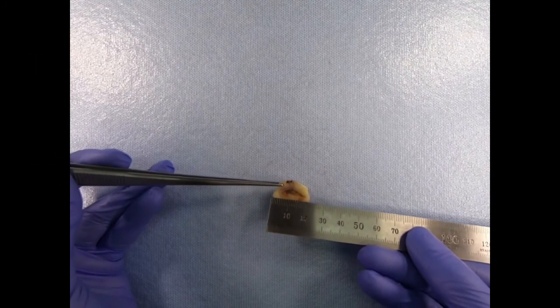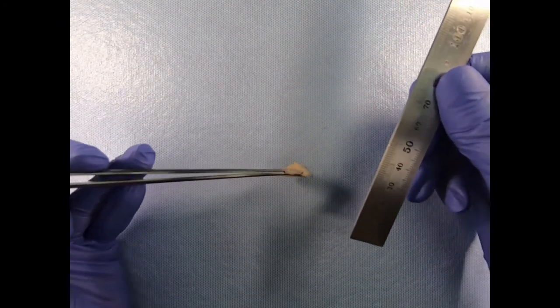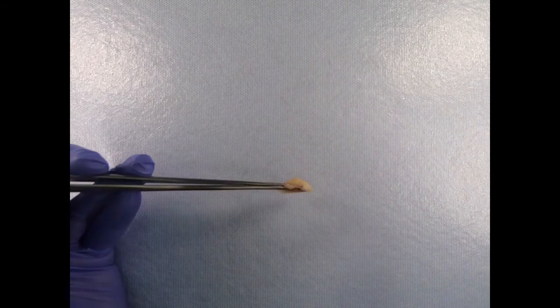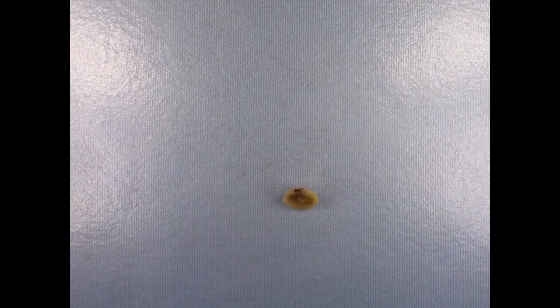Measure the ectocervix in 2 dimensions and the length of the specimen. Measure the diameter of the os. Measure the length of the endocervical canal upon sectioning. If tumor can be identified, describe the appearance, size, depth, location, relationship to the os, relationship to the canal, and distance to the margins.